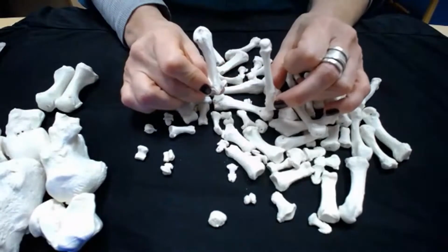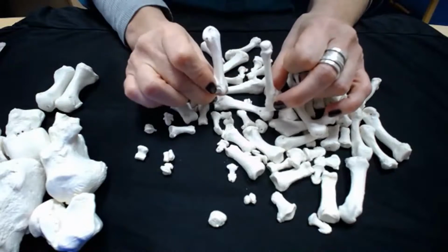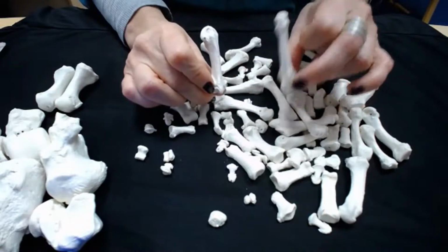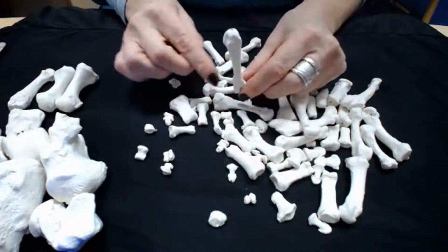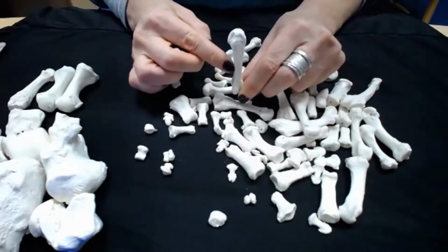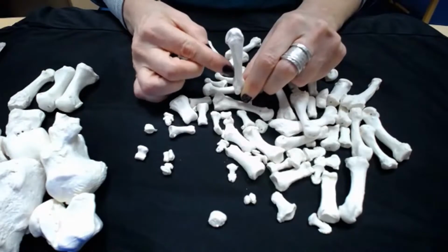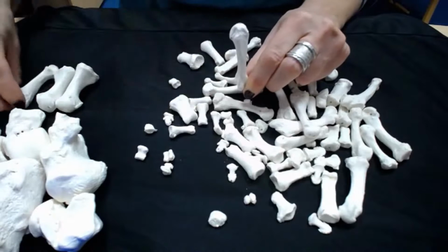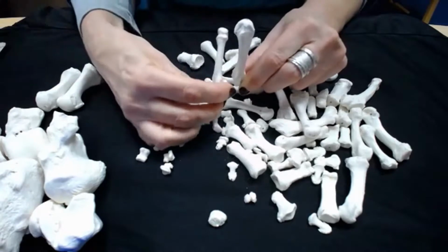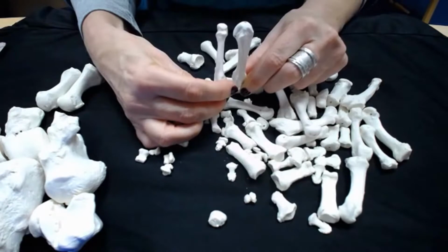It doesn't matter what size or shape these bones are. If you can see the shaft and see where it's becoming constricted, you know there's a metatarsal. Those are the metatarsals. I'm going to put this over in the metatarsal pile. Metacarpal, the area of greatest constriction is down by the base. You see it flares as it goes up to the head. It's constricted at the base, or sometimes it's more central, but that's the constriction. So if you compare the two again, can you see the difference? Constriction at the base, constriction under the head.